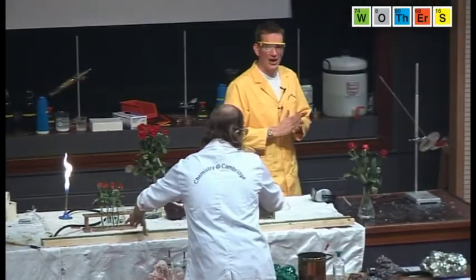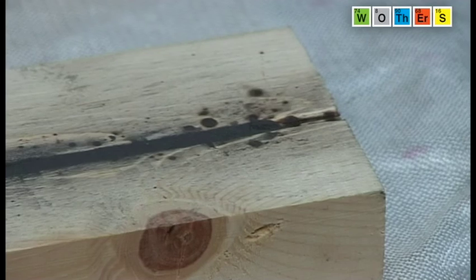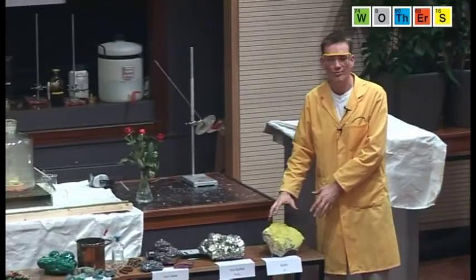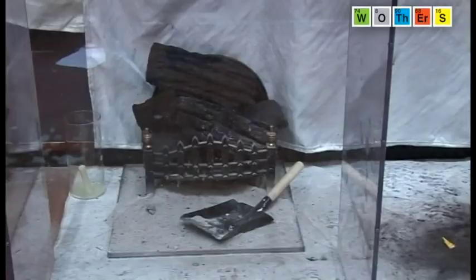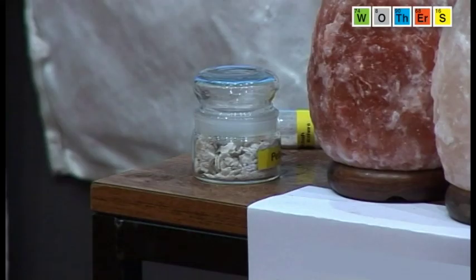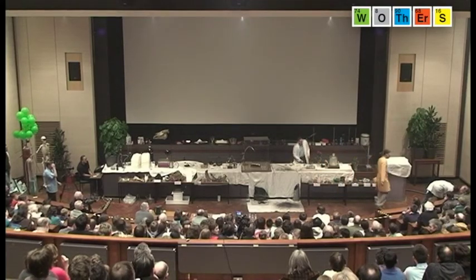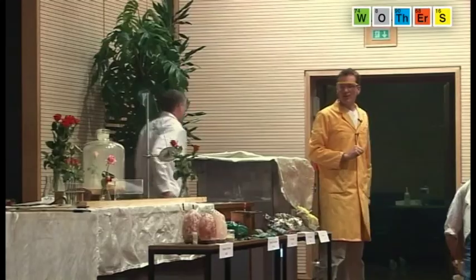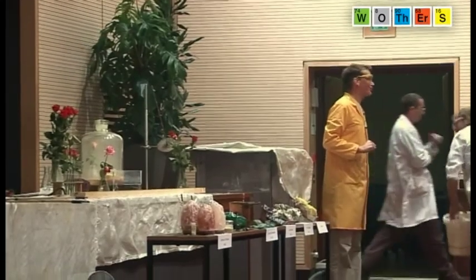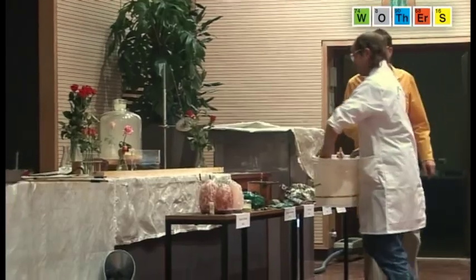Just to finish with the very last reaction then, we have some gunpowder on the track here. Remember, the gunpowder is a mixture of sulphur — perfectly natural — charcoal, that we started the lecture with, and the scrapings from the stable wall, the saltpeter. So the gunpowder is on the track here, but just to make it a little bit more interesting, we've got some beautiful Easter chicks to put on the gunpowder.